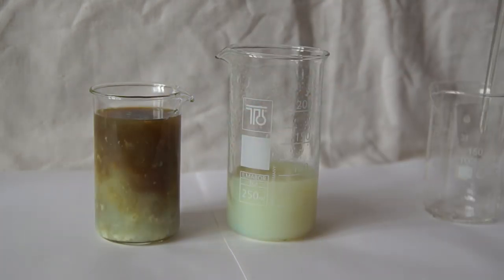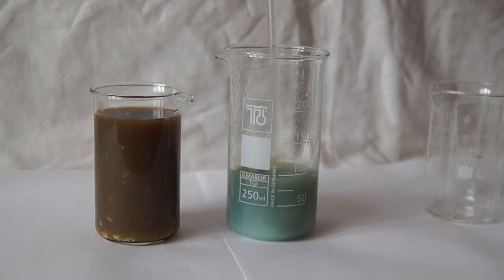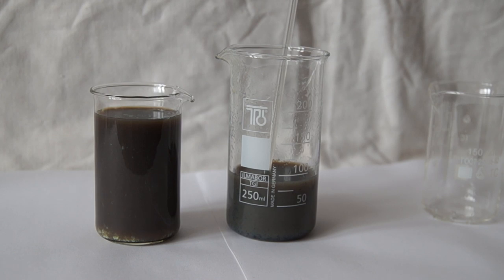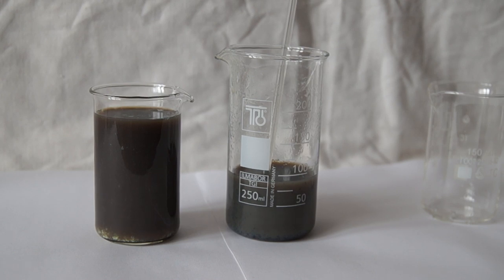Eventually the solution becomes black. During the second time the black color doesn't appear immediately but gradually because we haven't stirred the solution.